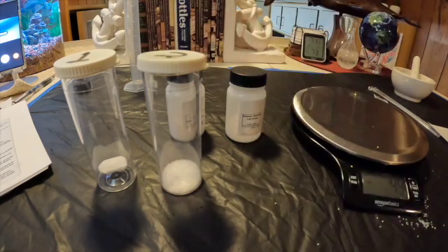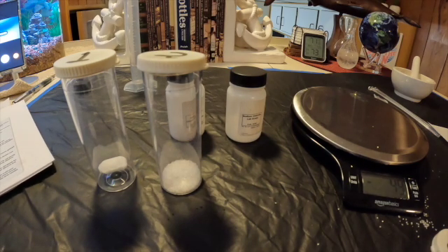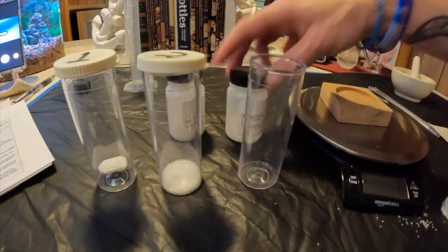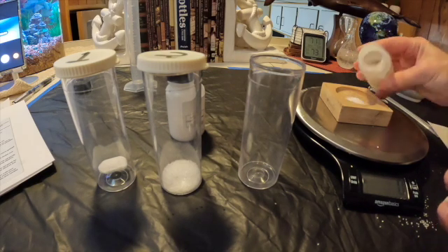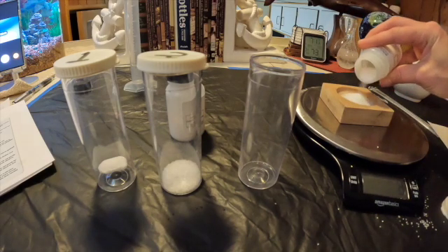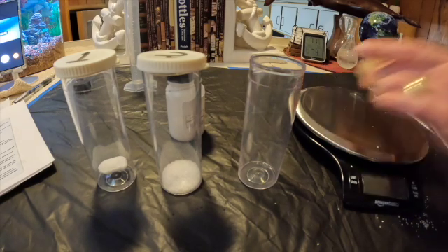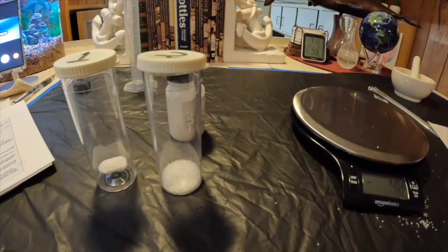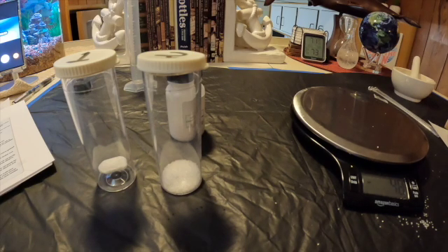In vial three, we're going to put fine grain salt — five grams of that also. So vial three is the fine grain salt.